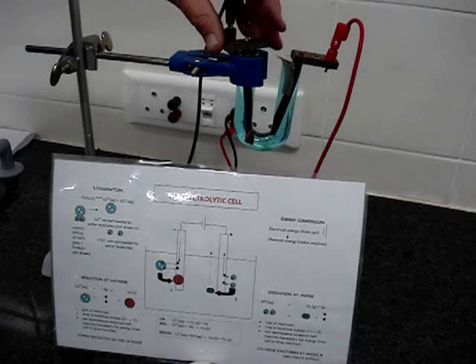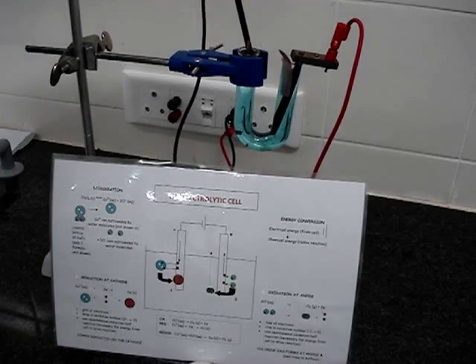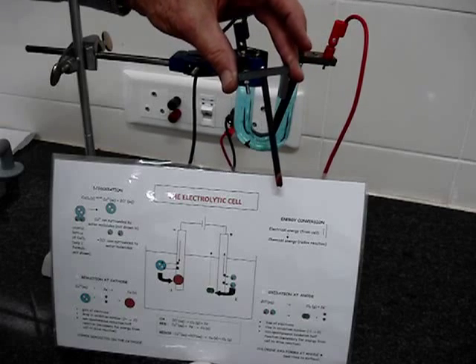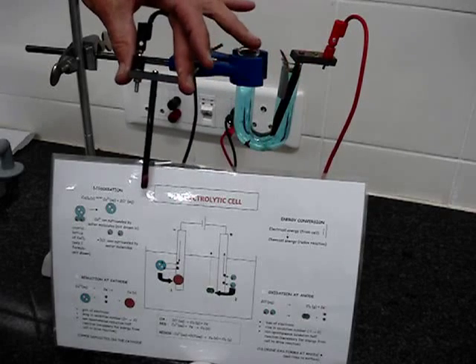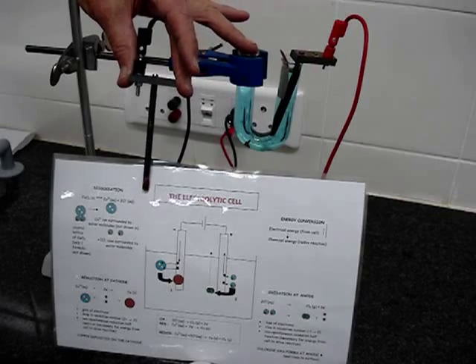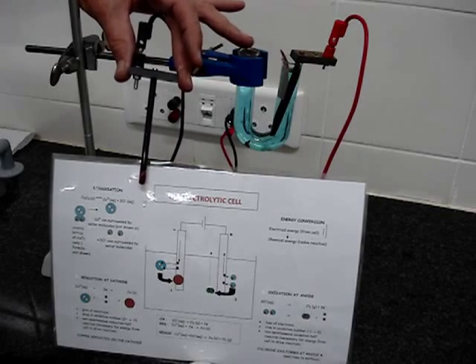We'll lift it out to make it clearer. And just bring it in front, and there you can see against the white, there is a brown precipitate, and that's a deposit of copper, the metal copper, copper atoms, which are brown in colour.